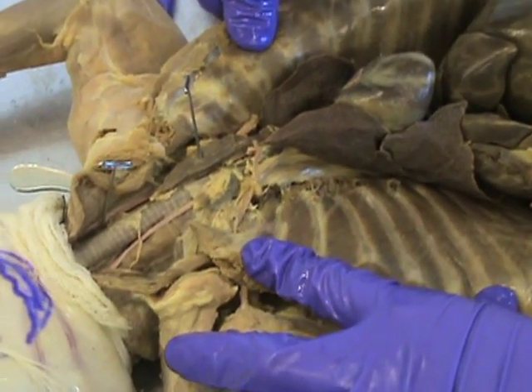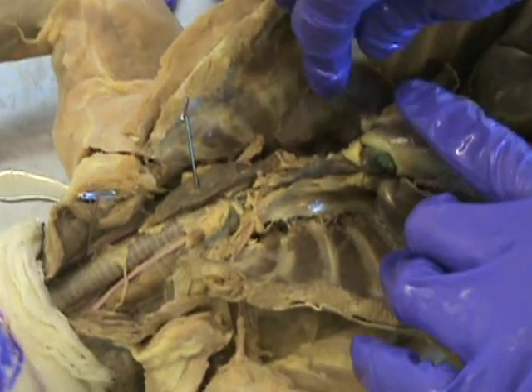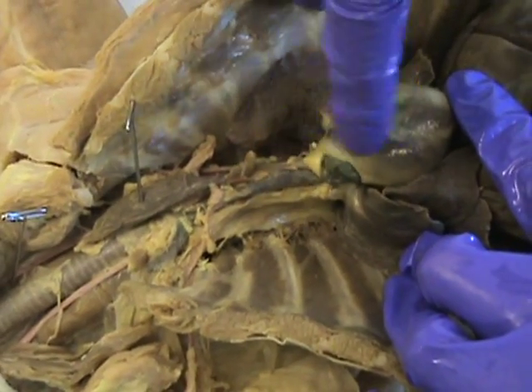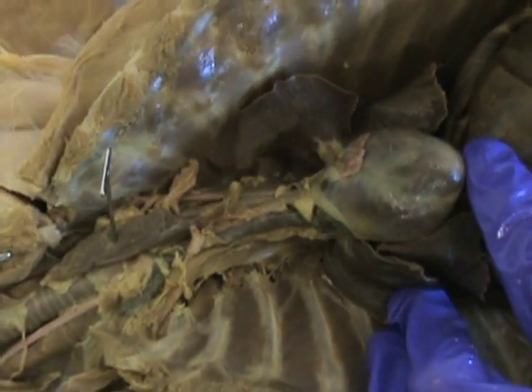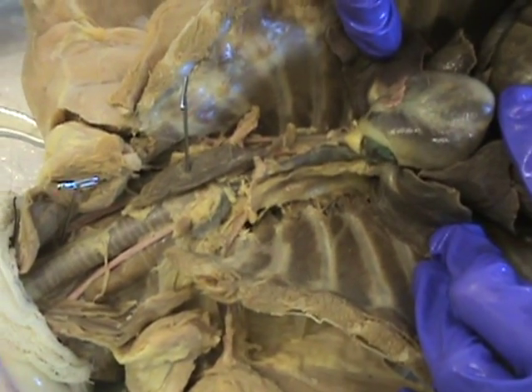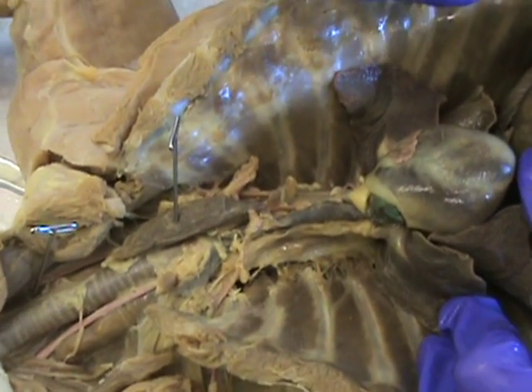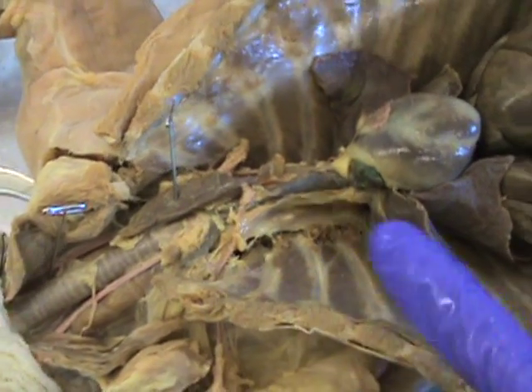Next is the thoracic duct, which we probably couldn't see, but it's in this general region where she's got her finger. If you want to be more specific, you should be able to find it from the aorta, but not on this cat. It returns lymph to the circulatory system.